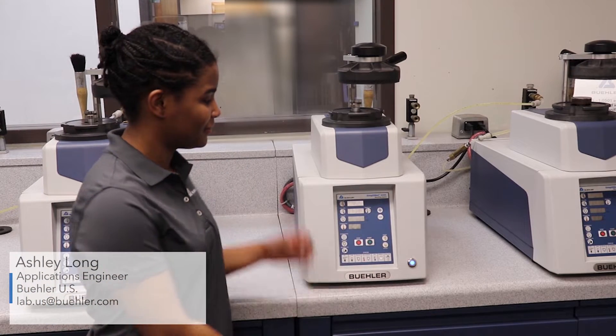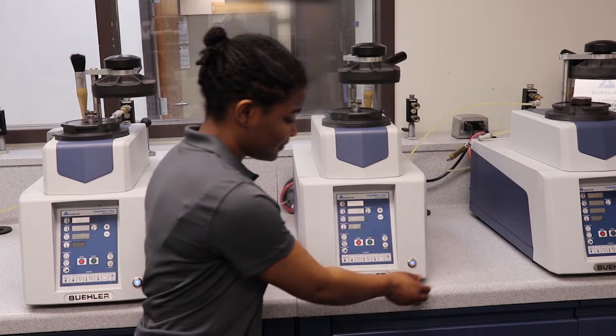Hello, my name is Ashley Long and I'll be showing you how to mount a steel sample using the SimpliMet 4000. Let's get started.